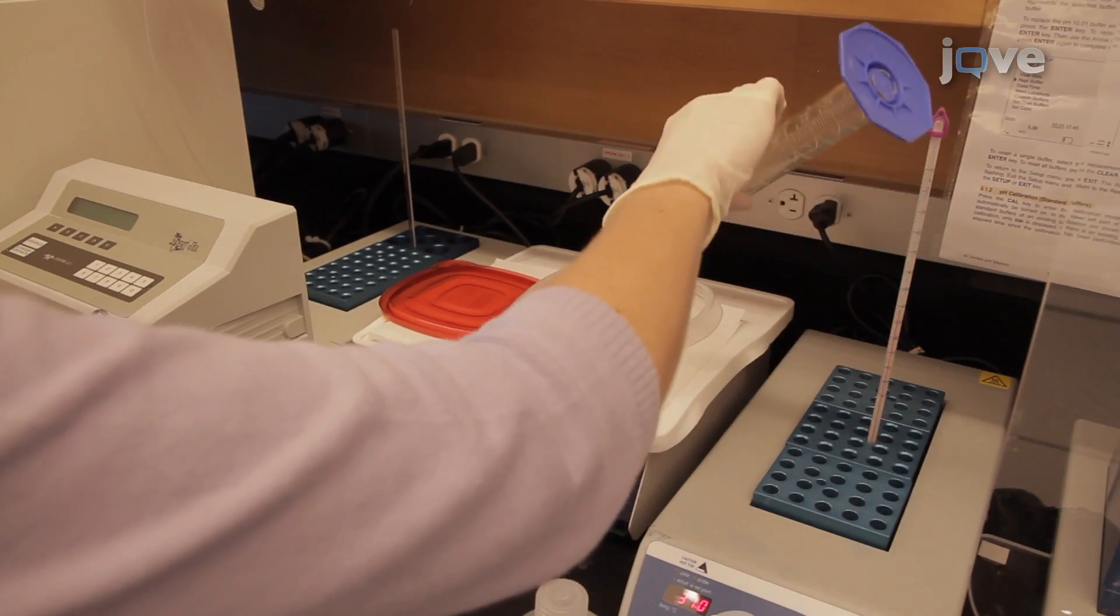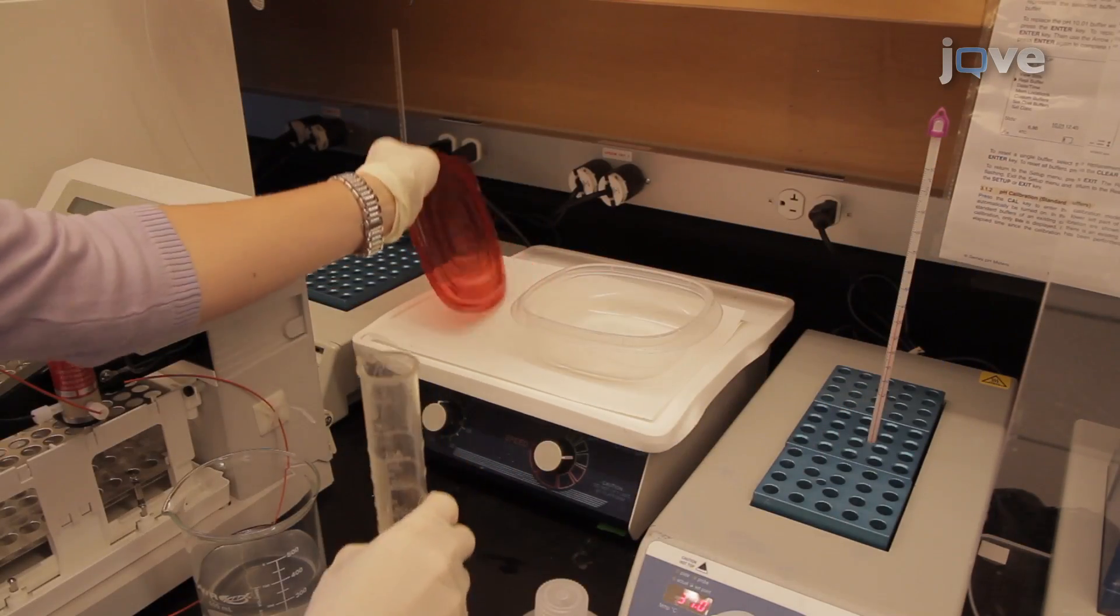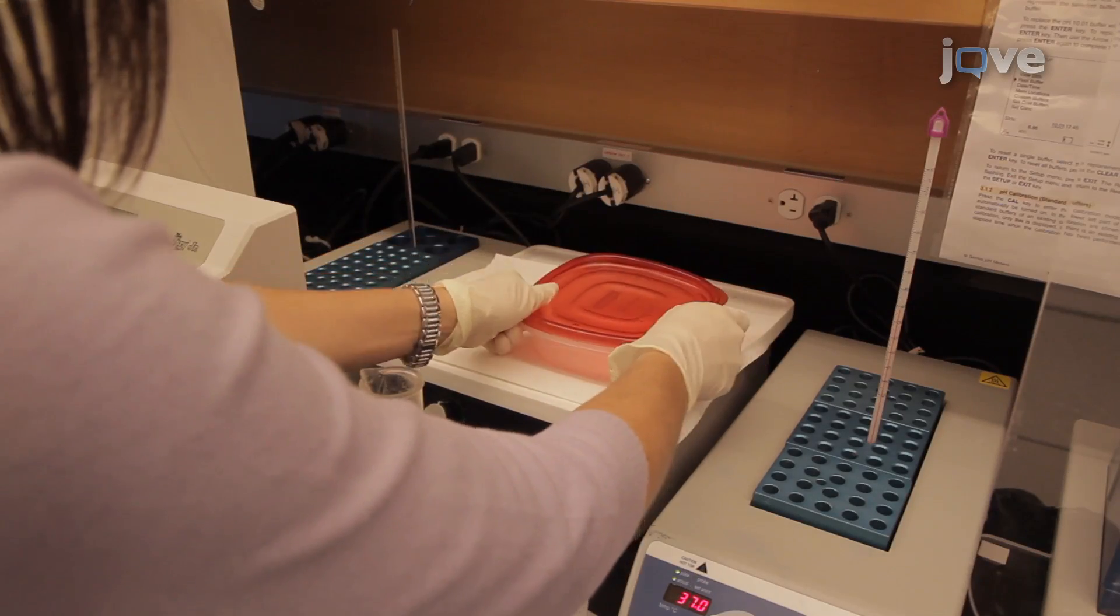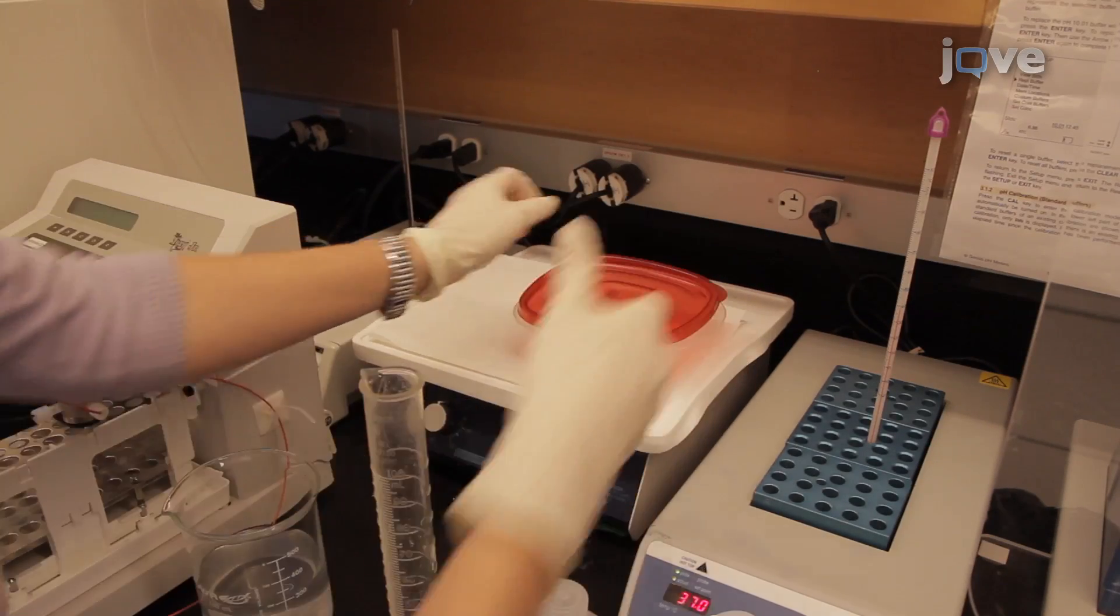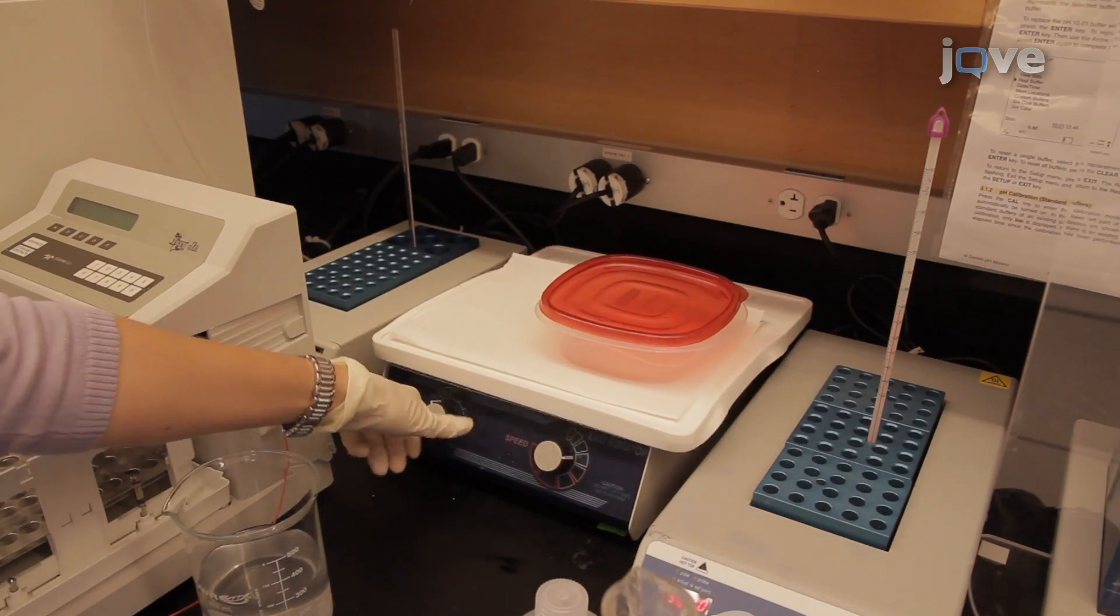Next, oxidize the carbohydrates by incubating the gel with gentle agitation for 30 minutes in 25 milliliters of the prepared oxidizing solution.